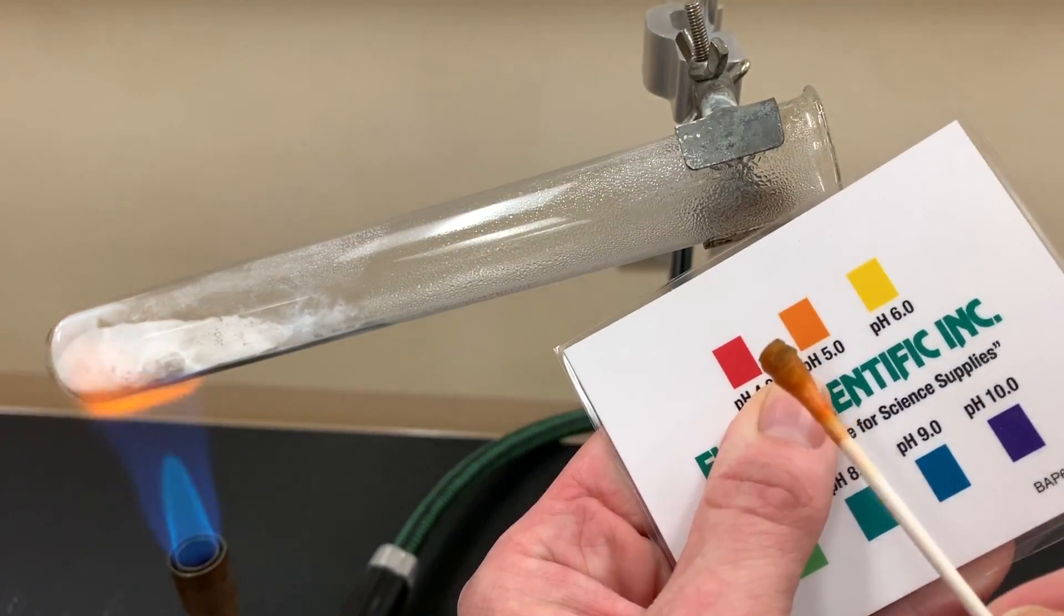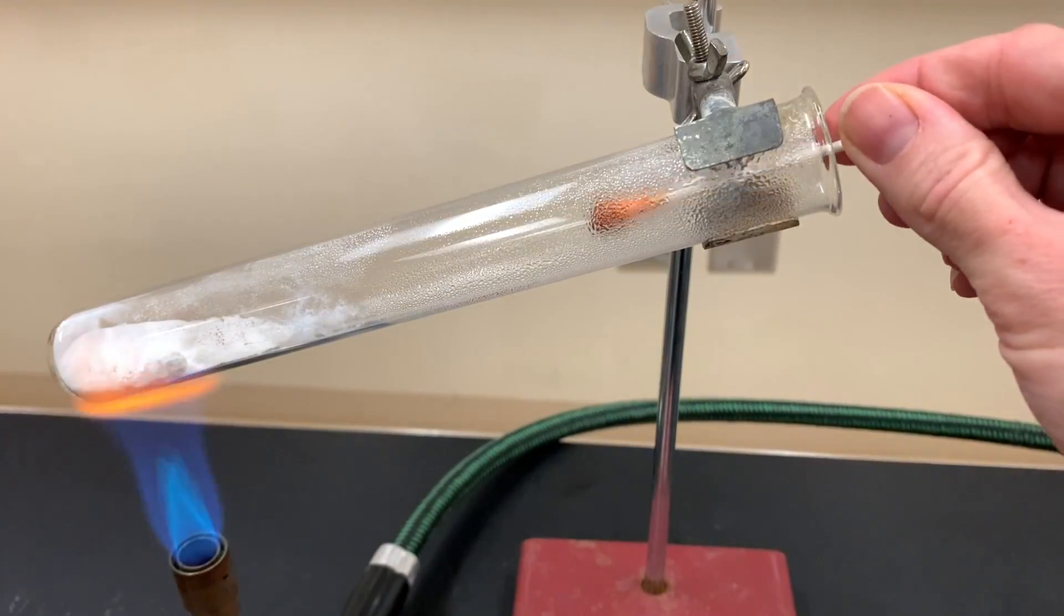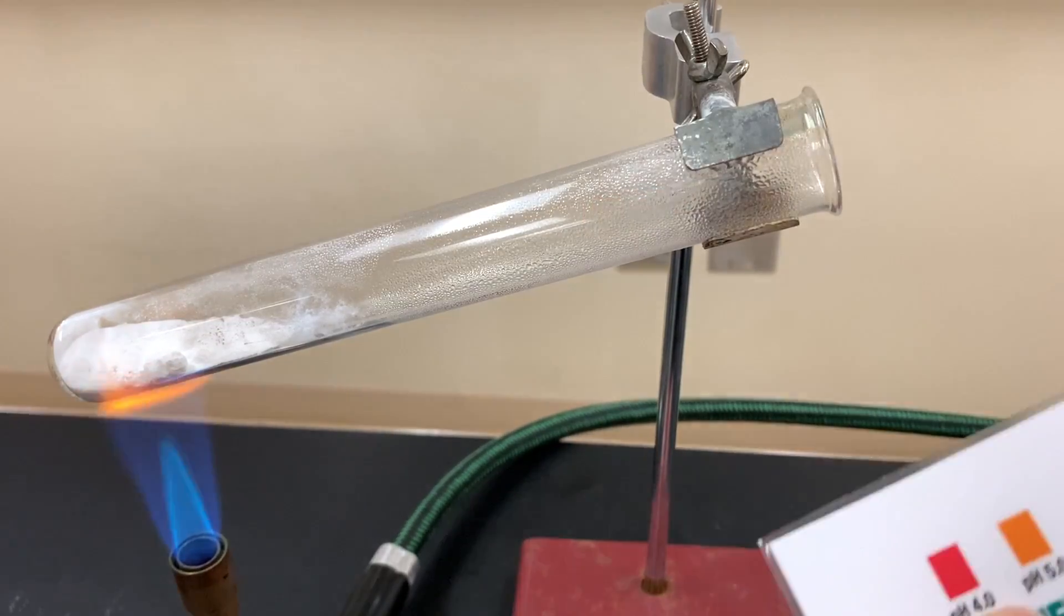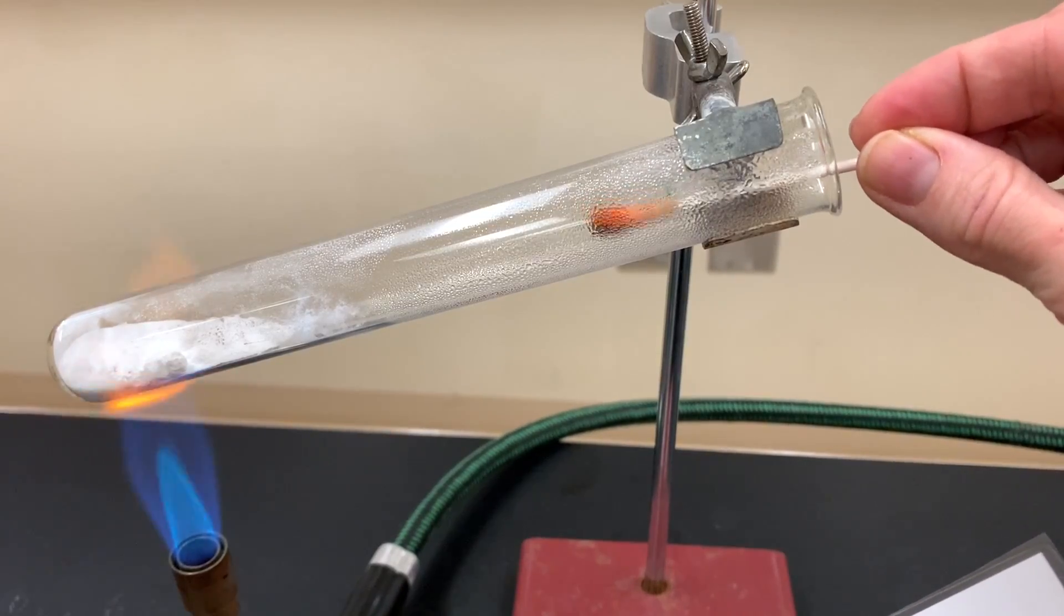Let me go one more time and just see if I can get the pH to be even a little bit lower. Again this is another positive test for carbon dioxide because carbon dioxide reacts with water to form carbonic acid.